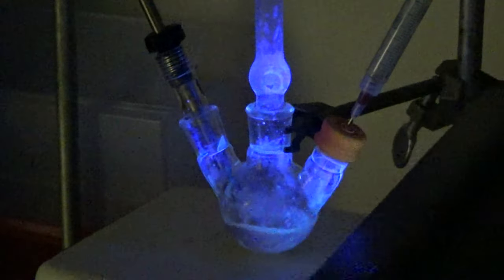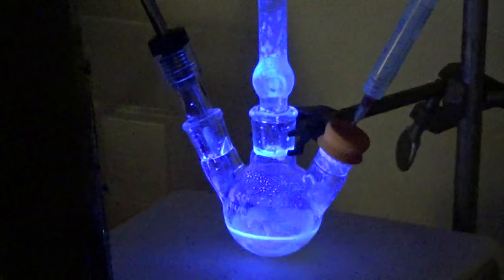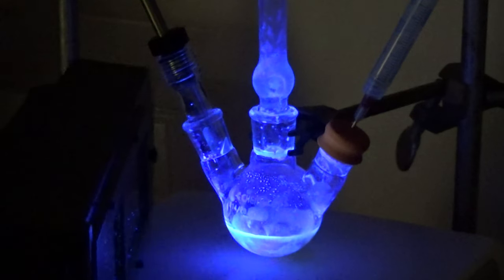When it's back to room temperature, as you can see here, it's got a nice cadmium sulfide yellow color. Turn out the lights, hold up the black light, and yes, now it's pretty decently bright.